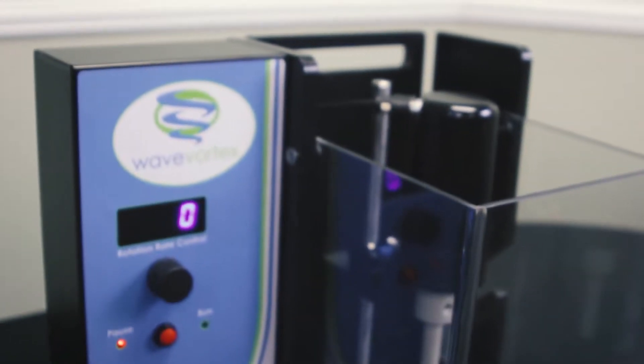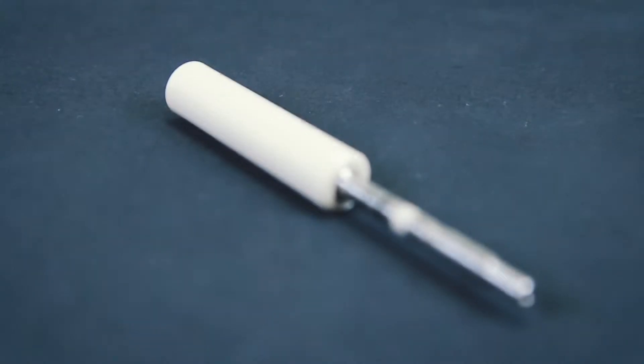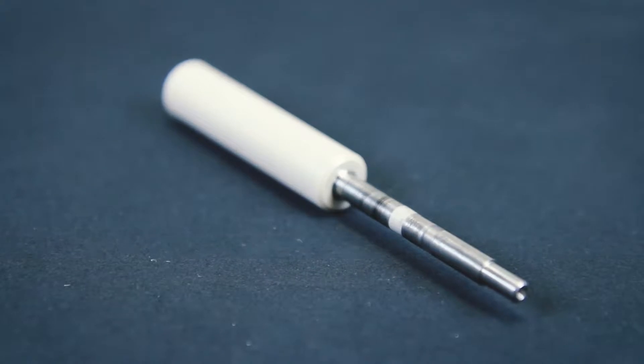In this video, we will be going over how to change the shaft on the wave vortex rotator. When changing the shaft, you'll want to work on a clean, flat surface.